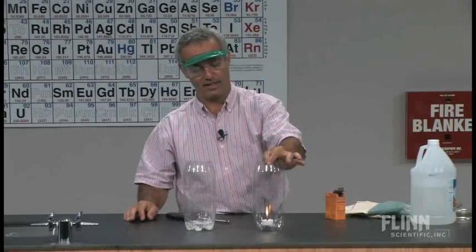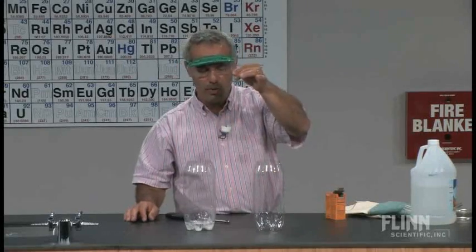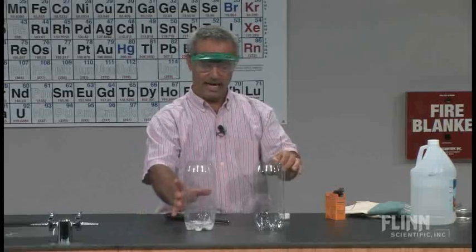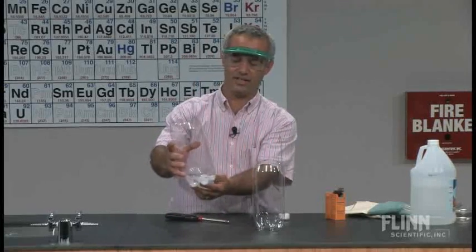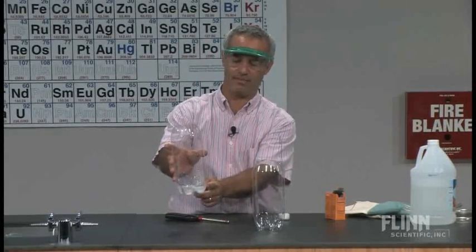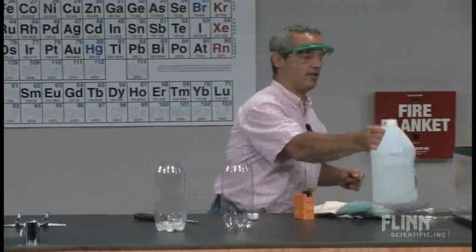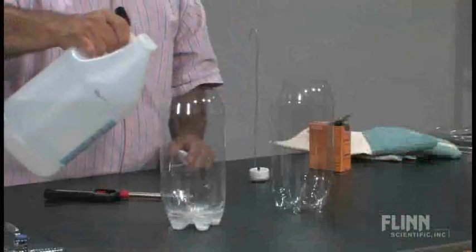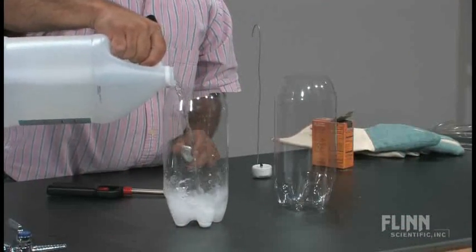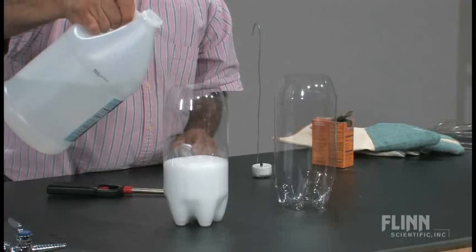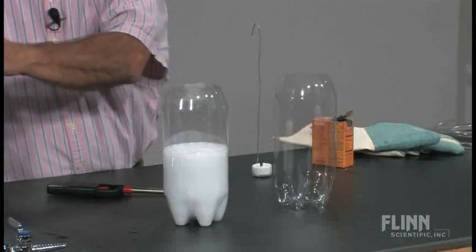So here I've reset it. We got that there. And I can tell in my reaction container that there's still plenty of baking soda on the bottom but the vinegar needs to be replenished. So let's generate some fresh CO2. Okay I think I have a full beaker's worth now.